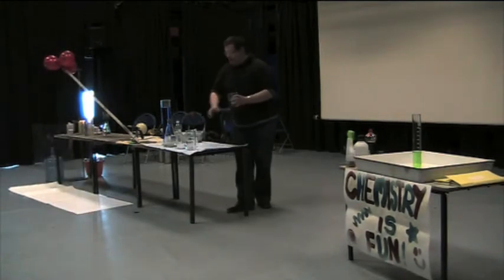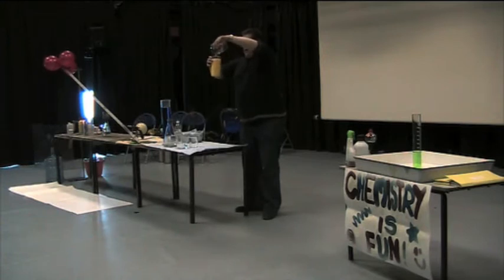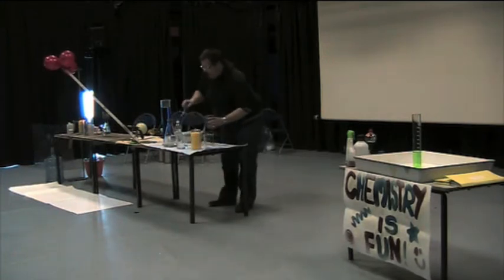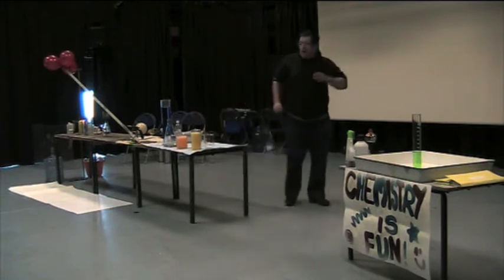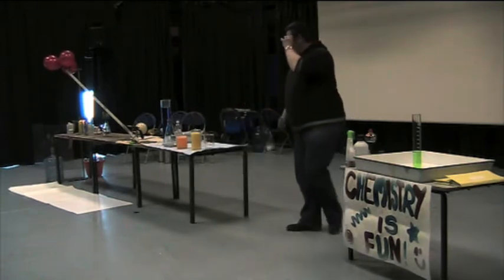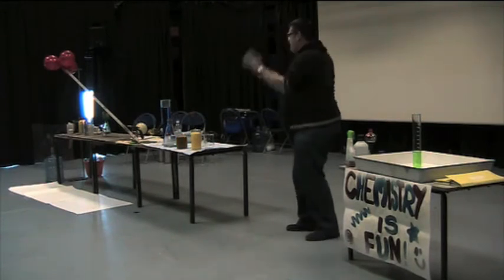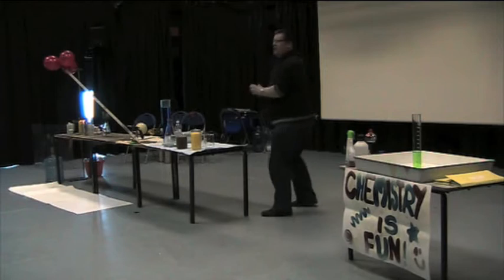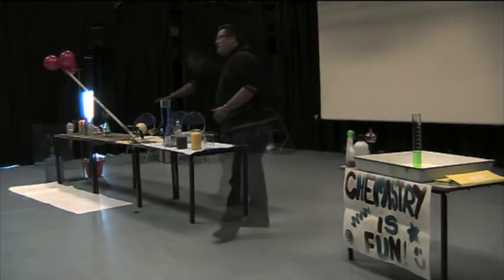Like taking two colourless solutions, as you can see here, pouring one into the other. When you pour one solution into another, nothing happens, and then after a little while you get a colour change, and then if you're really lucky, after a little while you get another colour change. That's an example of what's called chemical kinetics.